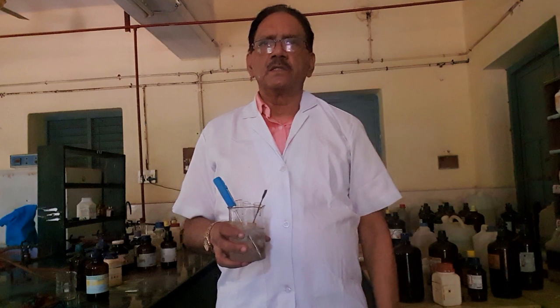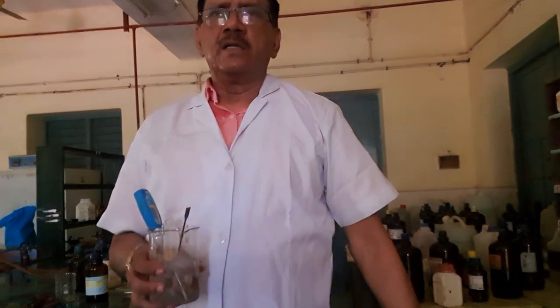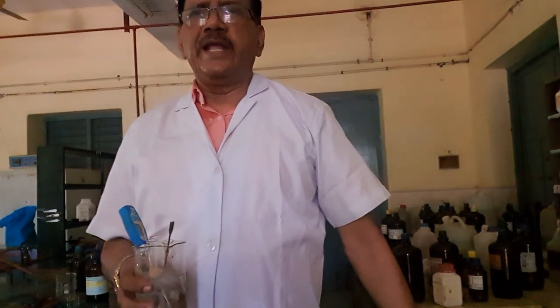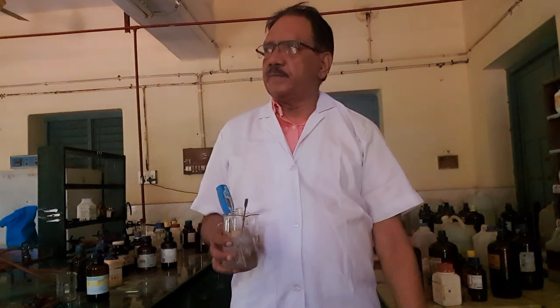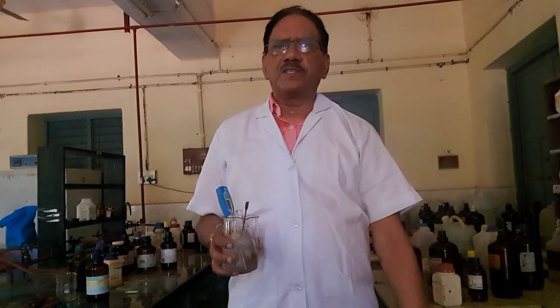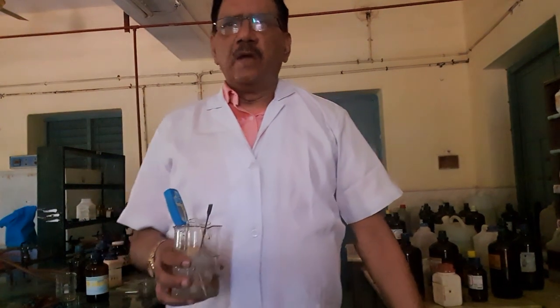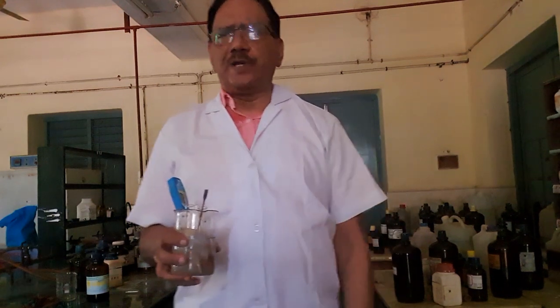Dear students, I am going to perform the next test, the amine test, specifically the aromatic amine test. In the aromatic amine, aniline is the aromatic compound, with the phenyl group, C6H5NH2. So the specific test is the dye test. Here we have to use 3 reagents, 3 test tubes.